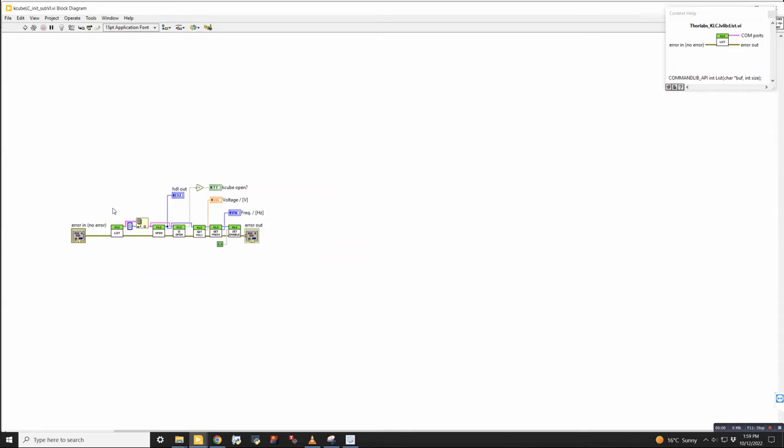So for us, basically what that is, first it's a list. So it lists the communication ports that K-Cubes take up on the computer. So we have just one, so it's always the same communication port. But if we had like 5 K-Cubes connected to the computer, this would output a list of 5 different K-Cubes. And what we would do is choose the K-Cube that we want. Since we only ever have one, it's always the 0th element of that list.